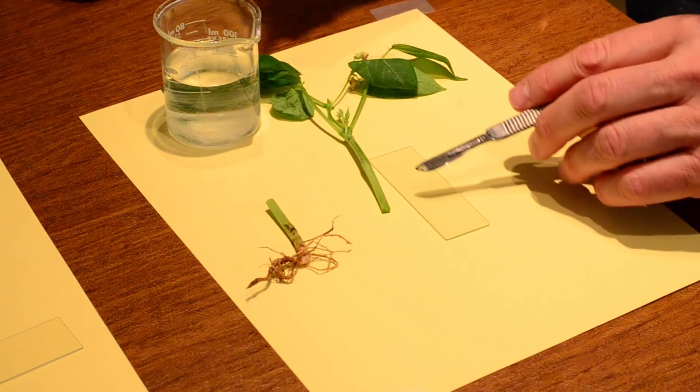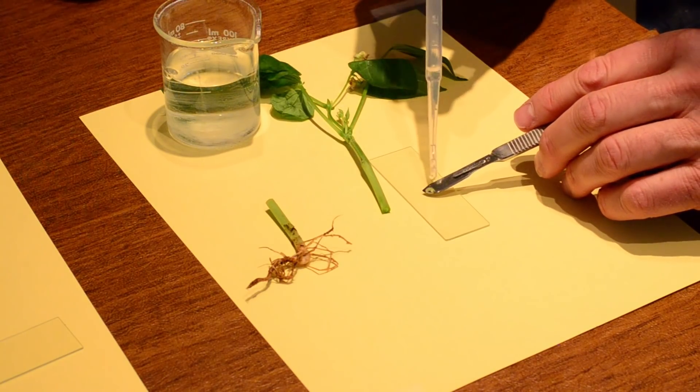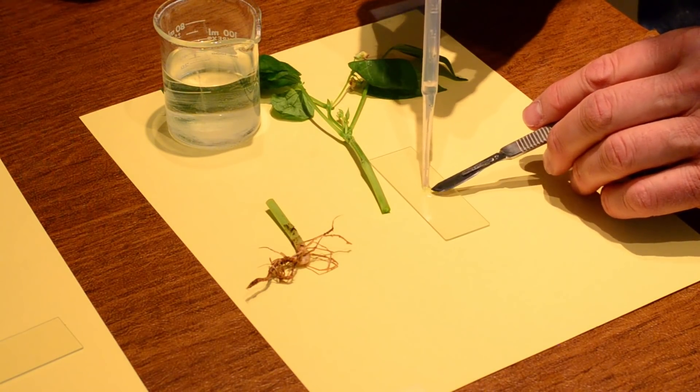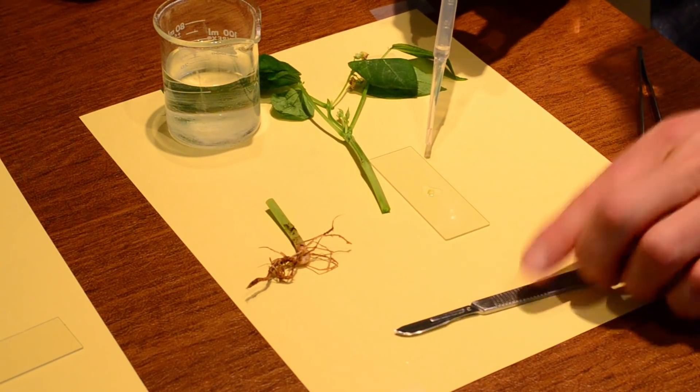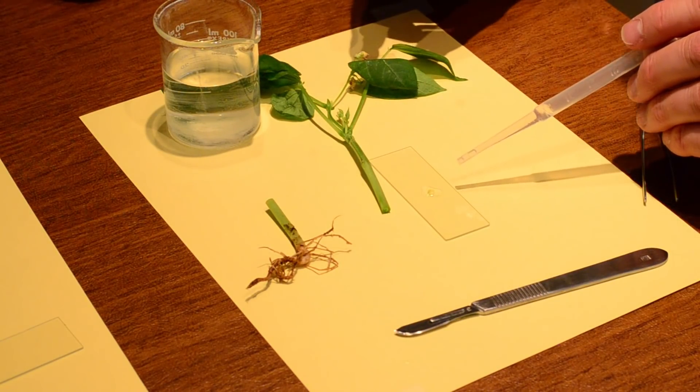And what I'm going to do now is grab the medicine dropper with some water. And I'm going to put a little drop of water right there. And right on top of my slide. And then I would put my cover slip on.